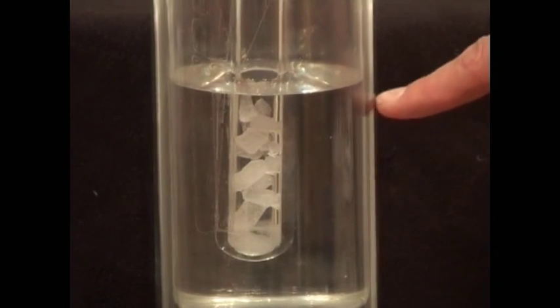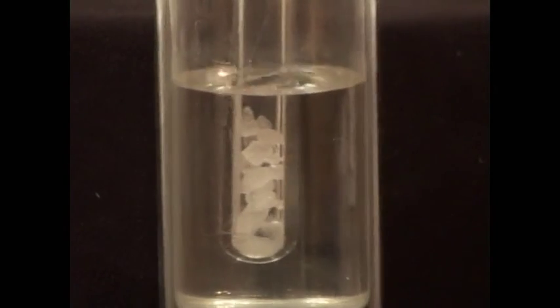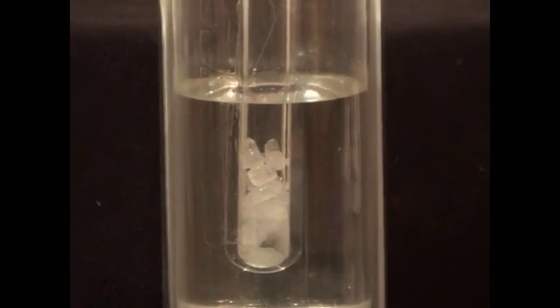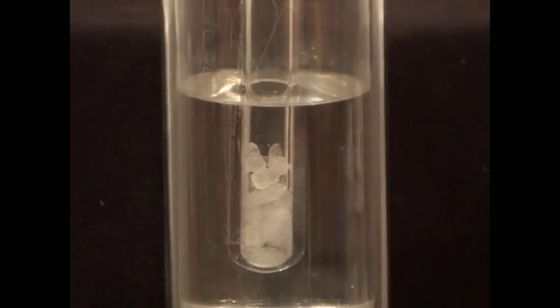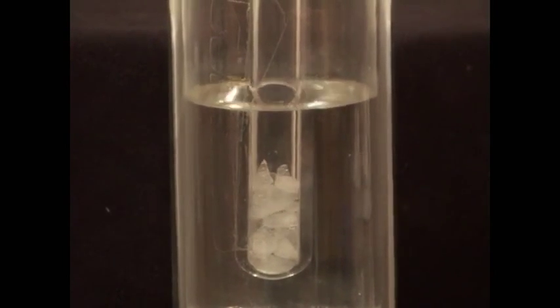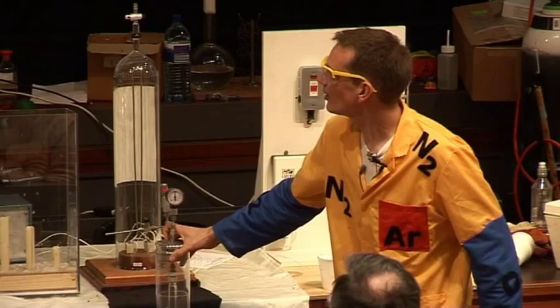It's melting. So we can get — there we are — liquid carbon dioxide. It's now forming liquid carbon dioxide, and there it is in the bottom of the test tube. It's melted to give me some liquid in there.